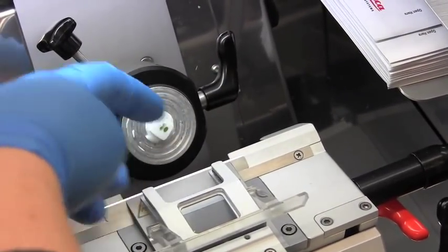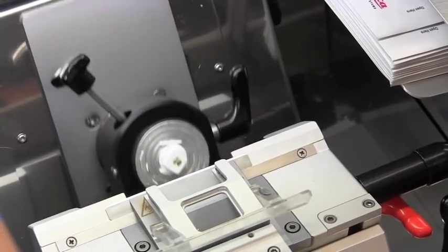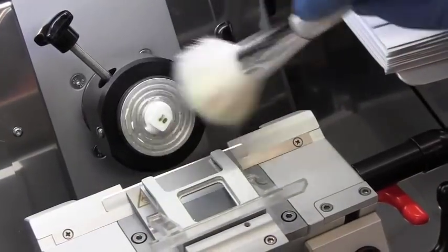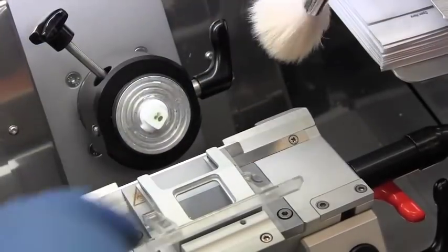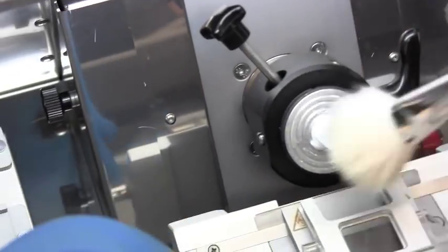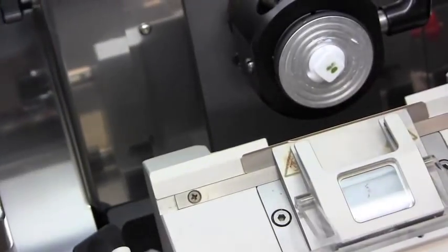That was a lot smoother. So now you can see we're getting into that other set of stems right there. And brush away any excess. When you're brushing try to brush straight down into this pan. Because when we clean at the end of the day that's how we're going to get it clean.